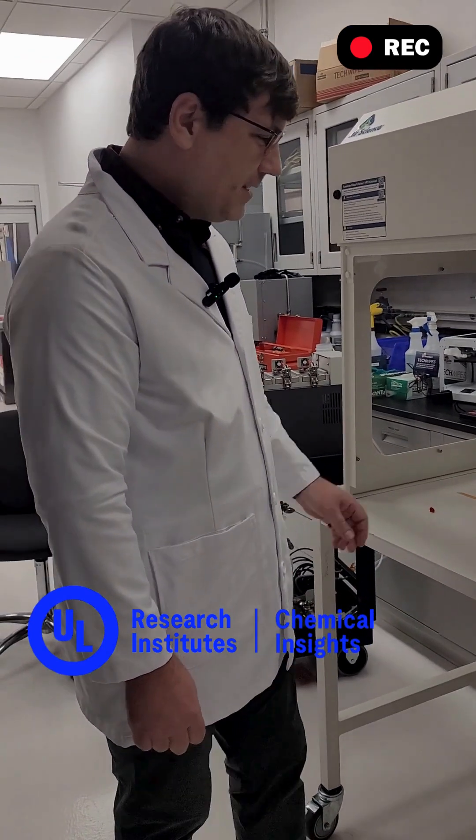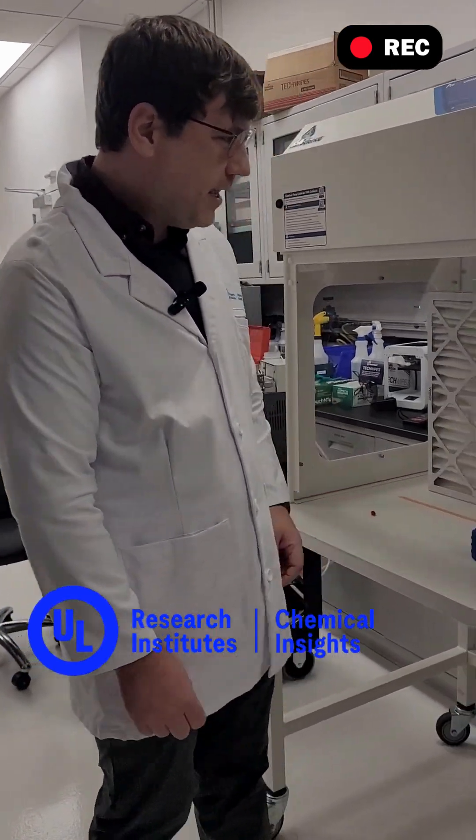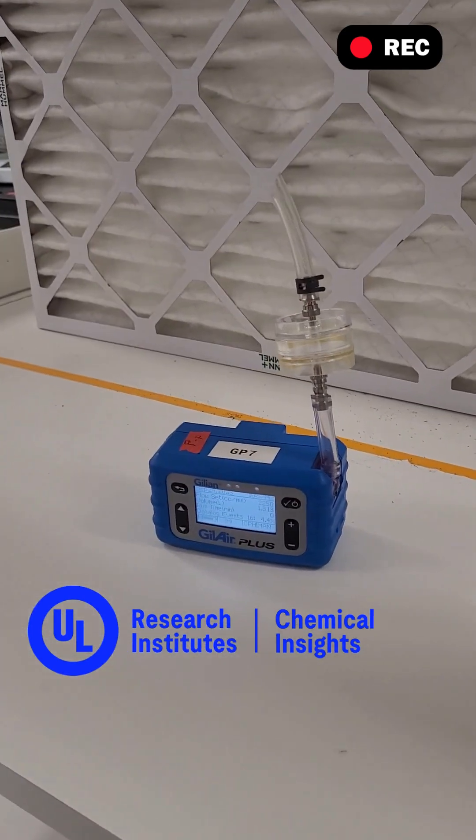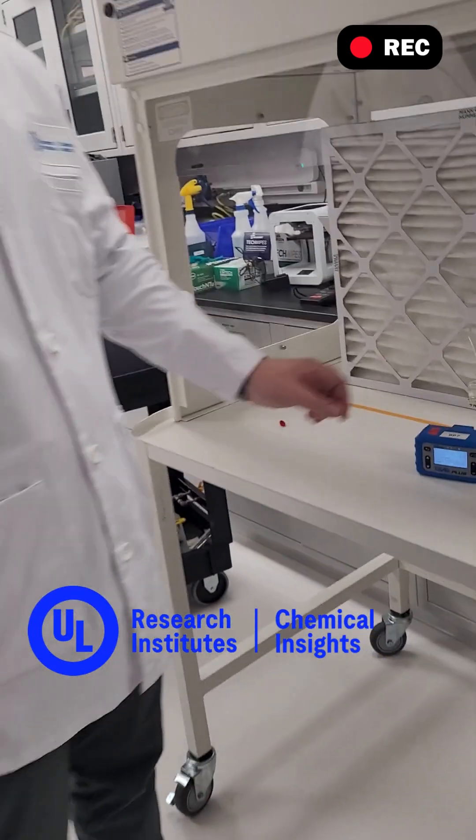So what are we doing here? Today we're looking to sample some of the particulate that has been captured on our air filter, and the way we're going to do that is using something called a micro vacuum.